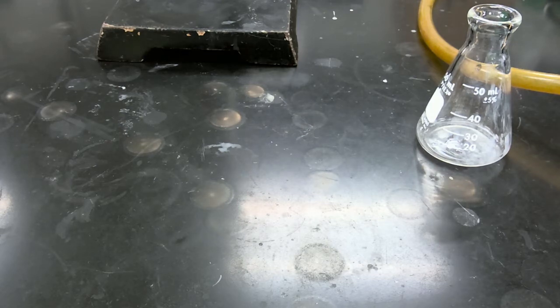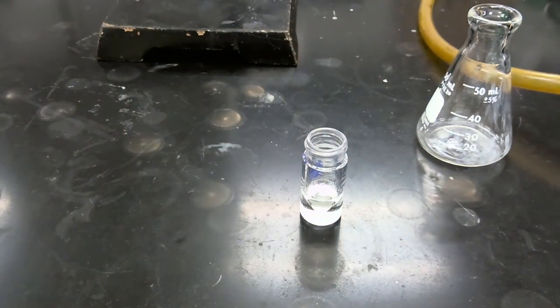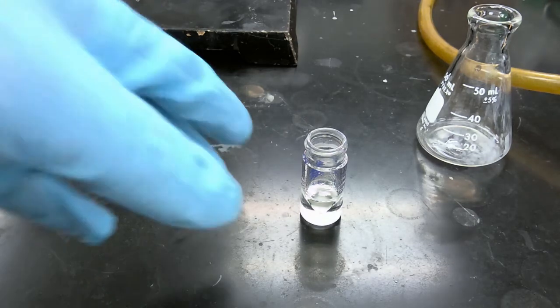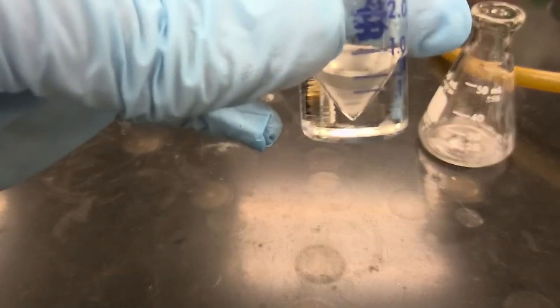One interesting thing to note is you can clearly smell the characteristic smell of acetic acid in your reaction mixture, especially in your aqueous layer. And that makes sense because the acetic anhydride is being hydrolyzed to yield acetic acid and eventually sodium acetate. Okay, so let's remove our aqueous layer once again.